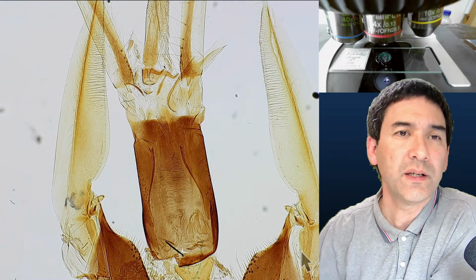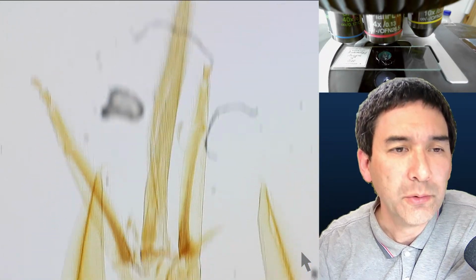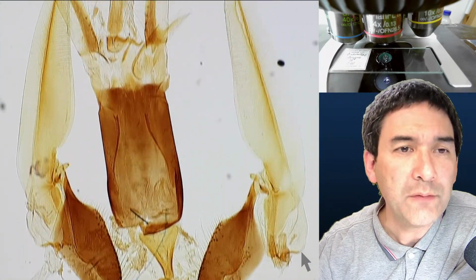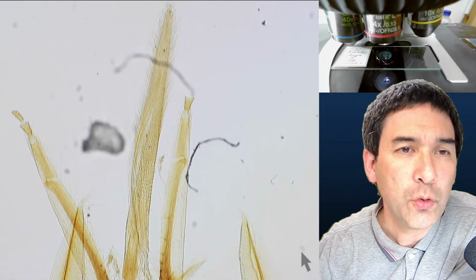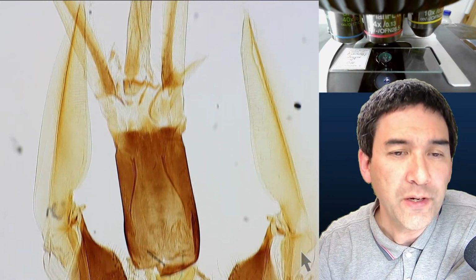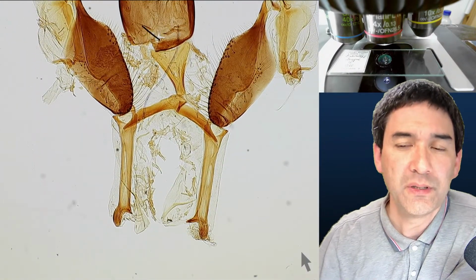This is how it looks. Also the front part of it. There's a little bit of dust here on the slide. I guess it's okay. Again, at the lowest magnification, it would look quite interesting if we could actually have a complete picture. And then in Photoshop, you can also remove all of the dust and the dirt and all of these imperfections. So that's generally a possibility as well.